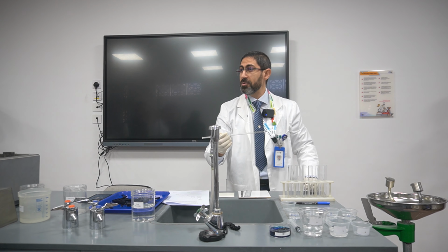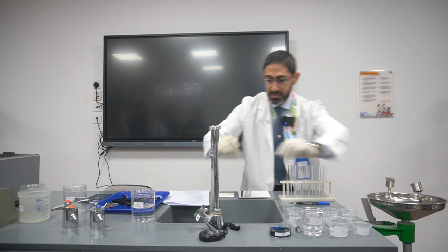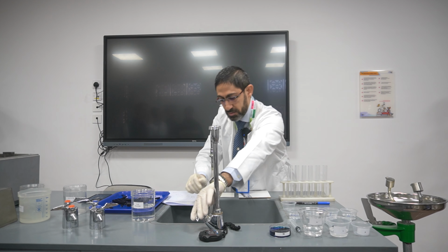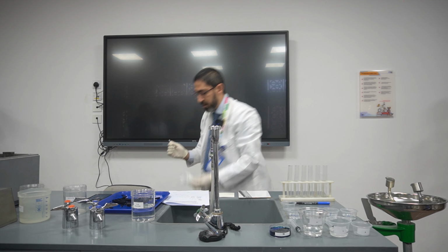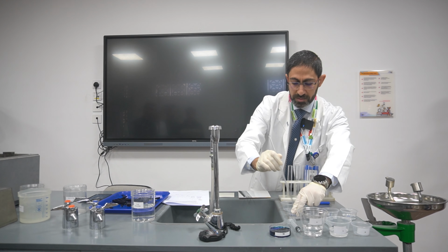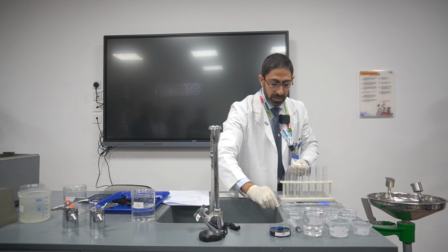I forgot to do something. You didn't tell me. I have to stir here. Okay. And after stirring, what shall I do? Rinse. Stir the second, and afterward I have to rinse. Okay, I dry it in order not to have any droplets of water that may affect the percentage of the concentration. Here I stir it and I will rinse it. Okay, dry it in order to be pretty sure that there is no additional water.